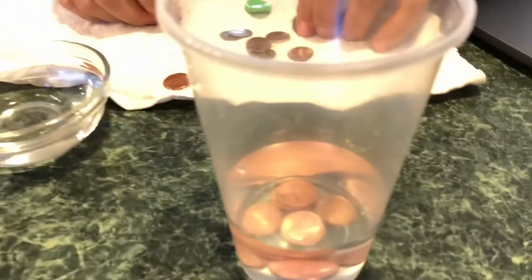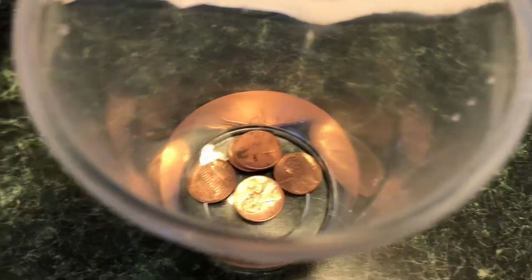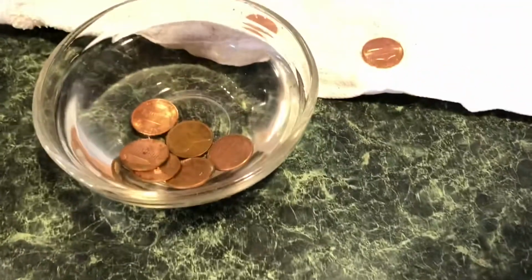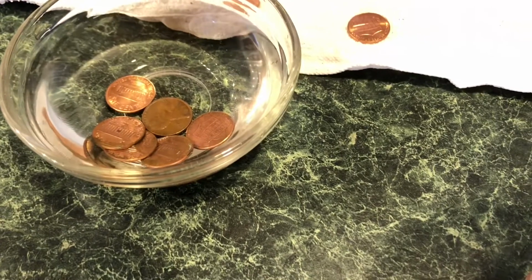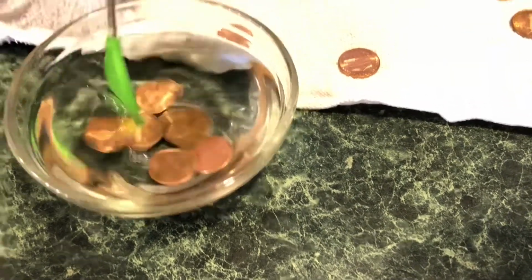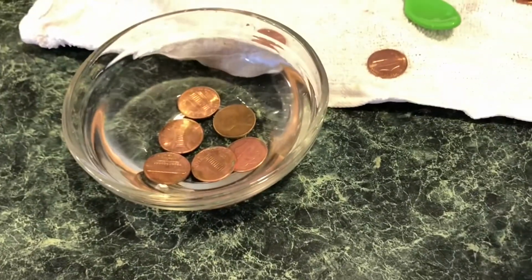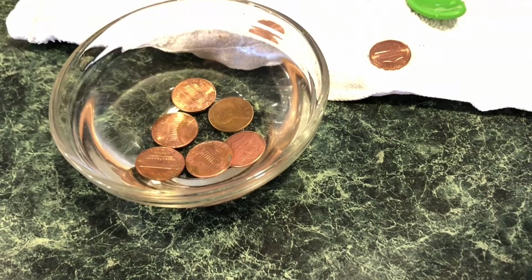Next, we're going to try a new experiment. And you can see here, the pennies are much cleaner than when the original went into the mixture. Next, we're going to throw some new pennies in there, and you can see how they instantly start to become clean. It's actually really cool. All that dark, gooky griminess just goes away. You can see good old Abe Lincoln start to reappear.